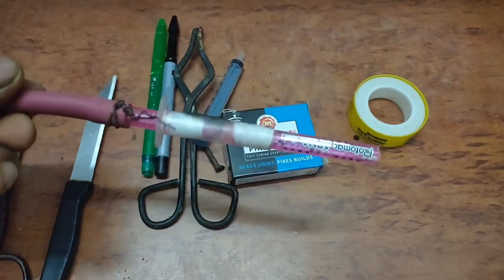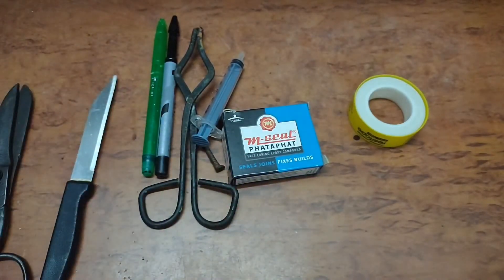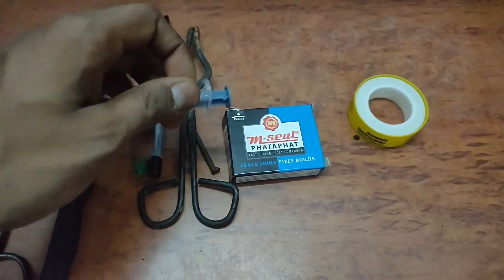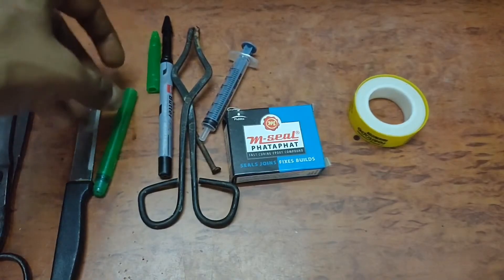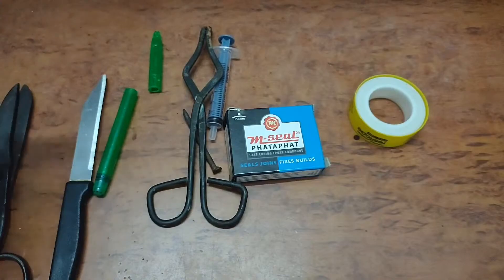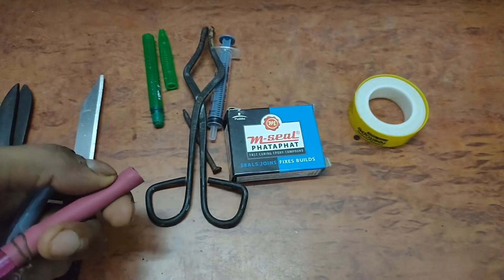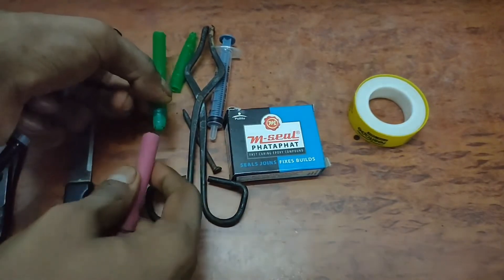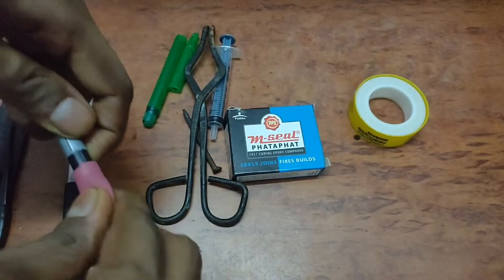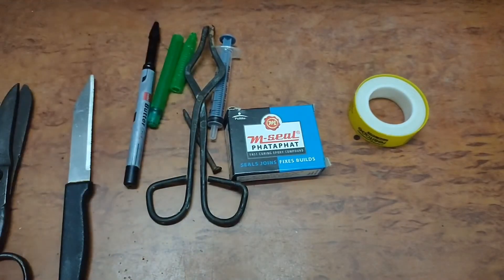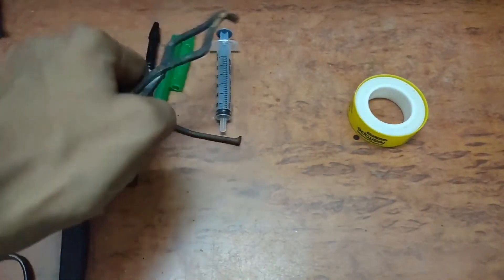In this video I will show you how I made this vacuum aspirator pump. For that we need a 3ml syringe, a pen which I have cut into half, another pen whose nozzle I will be using. You can see this nozzle fits very well into this rubber tube, so I am going to make a nozzle from the hose of the second pen. We also need some tongs, m-seal which is epoxy putty, and teflon tape.